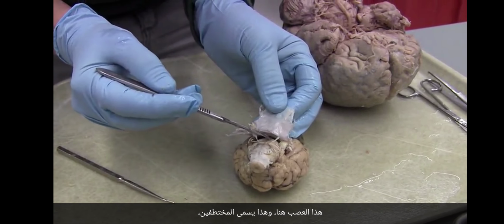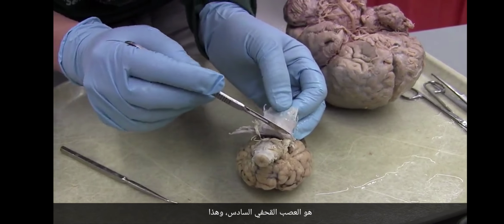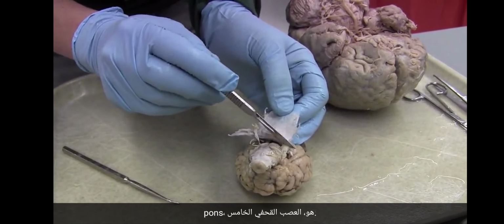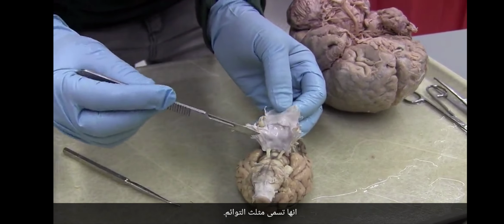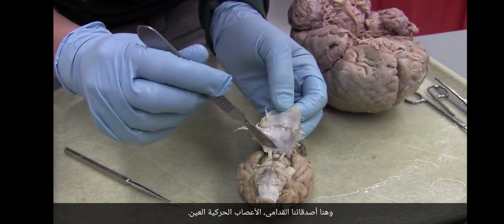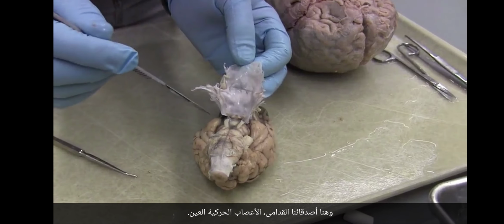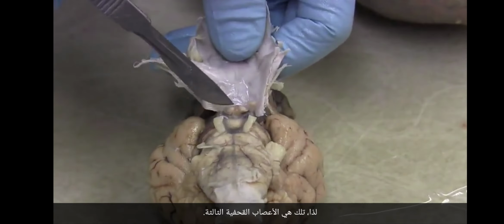This nerve right here, this is called abducens. It's the 6th cranial nerve. And this big nerve right here that's coming off the side of the pons is the 5th cranial nerve. It's called the trigeminal. And here are our old friends, the oculomotor nerves. They're the 3rd cranial nerve. So those are the 3rd cranial nerves.